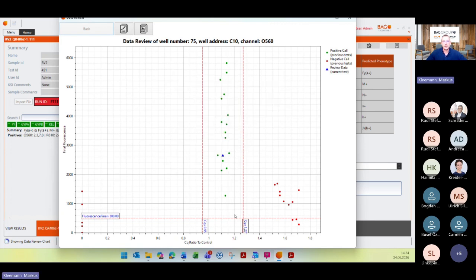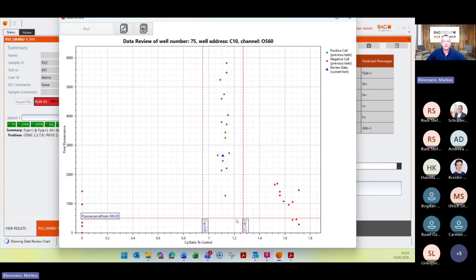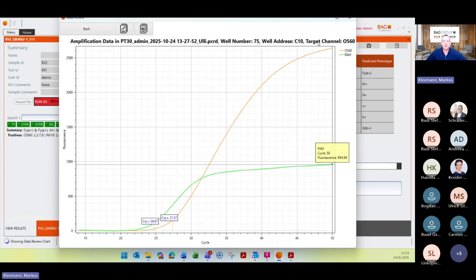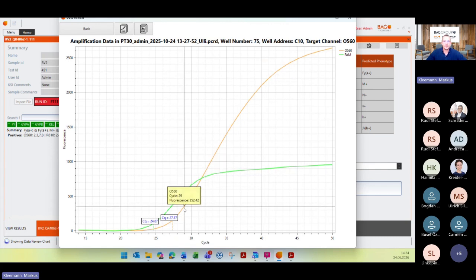Then the second parameter is the final fluorescence. So the positive reactions have to be located over this border here. And then the last parameter, which is important for the positive reactions and also for the quality score itself, is the shape of your target curve. So PlexTyper looks at how this curve statistically compares to a perfect sigmoidal curve.